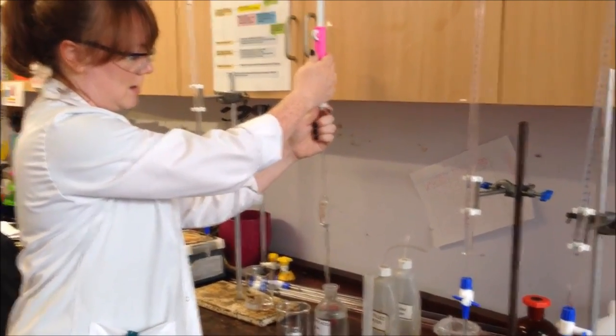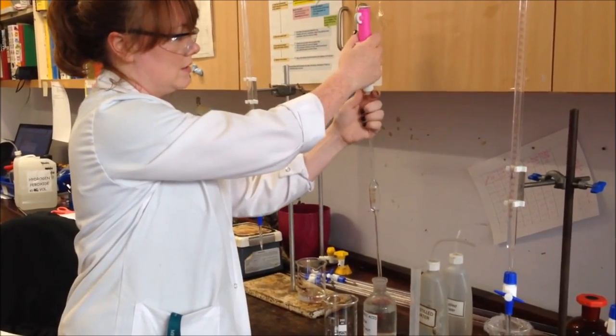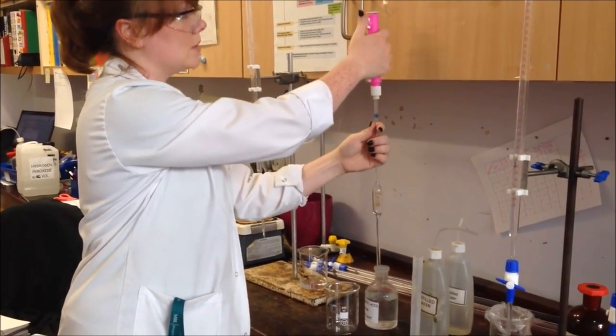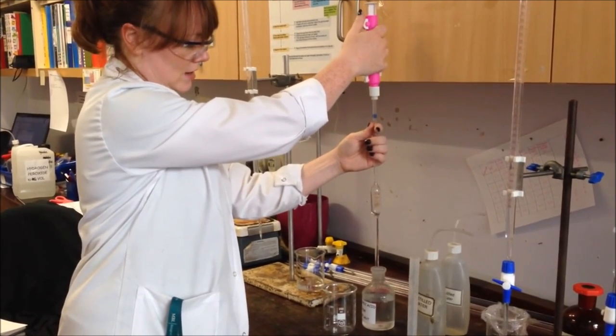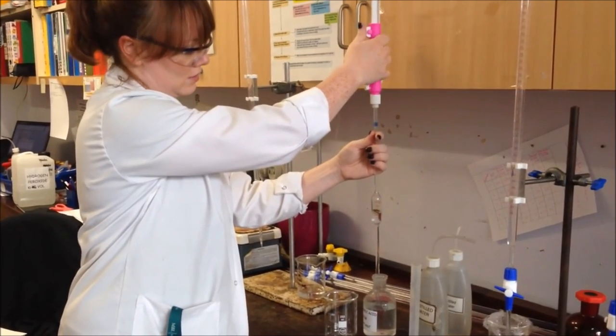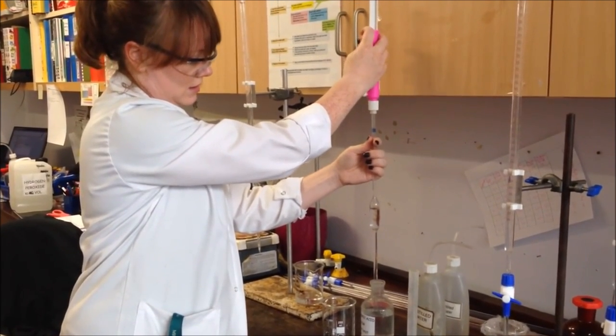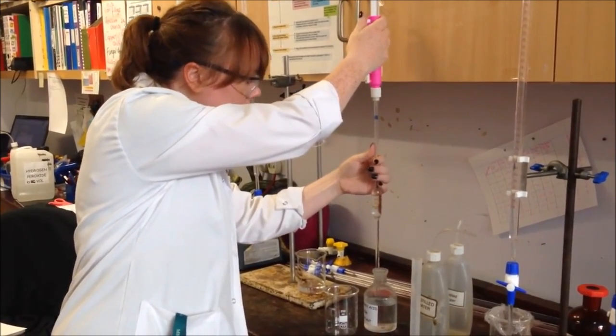Hang on a second, I'm just going to empty that and go again. These pipette fillers are quite old and sometimes can be quite temperamental. If you have bubbles in there, don't worry, they should pop. And it is the 25cm³ line, just here.